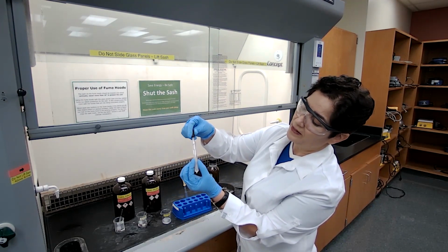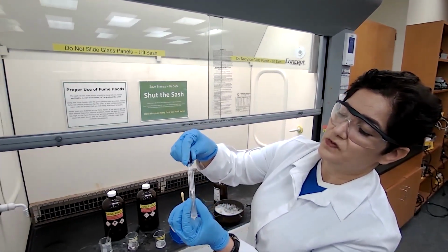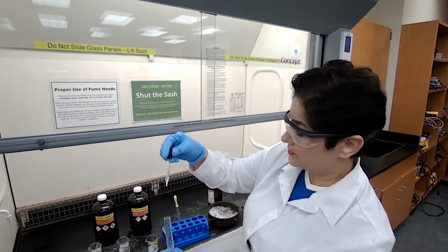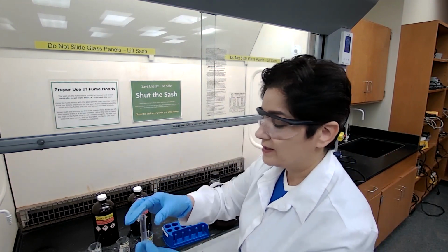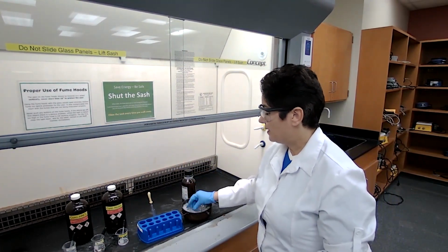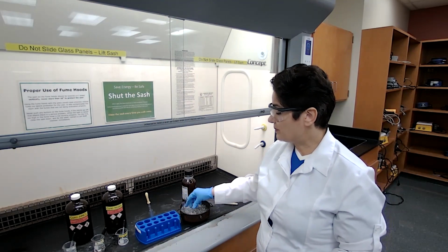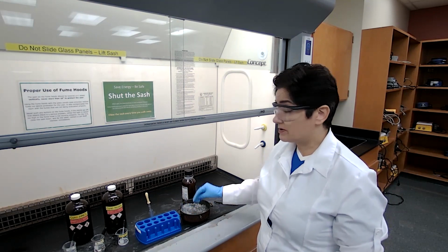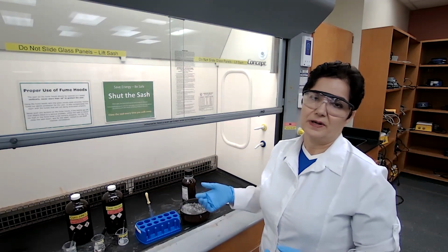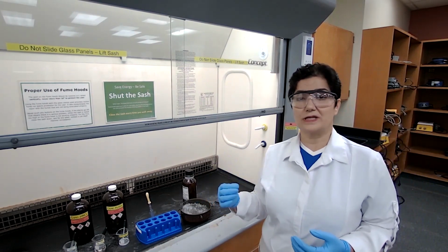Basically, I'm dissolving methyl benzoate inside the sulfuric acid. 2, 3, 4, 5, 6, 7, and 8 drops of the methyl benzoate. I will place it back in the ice. Why are we using the ice bath in this case? Because we want to make sure that the reaction mixtures separately are cooled to about 5 degrees. Placing the test tubes in ice for 3 to 5 minutes is going to assure that the temperature stays low.